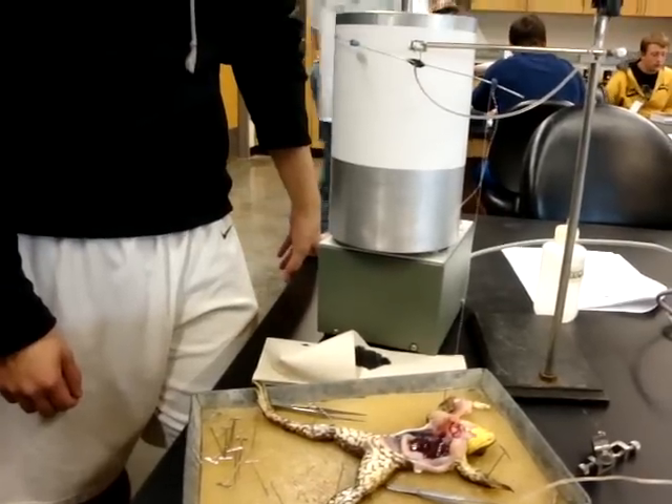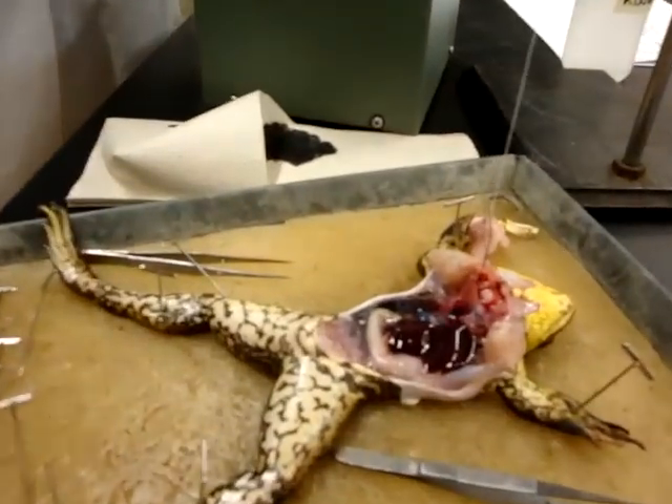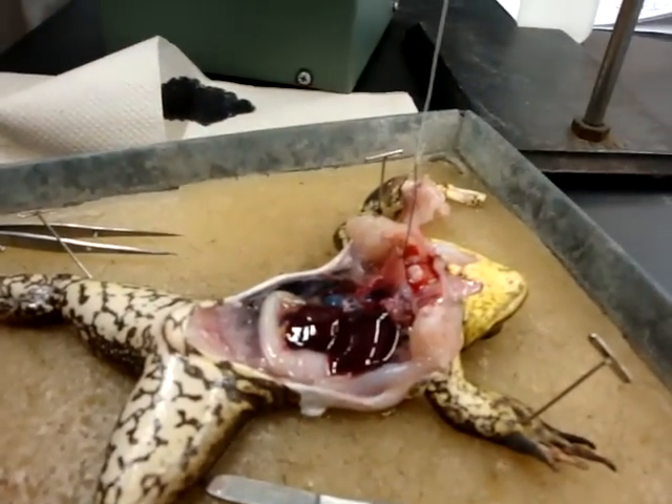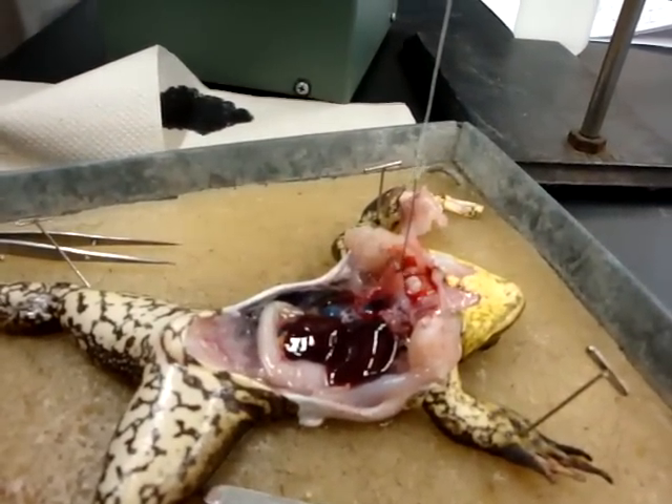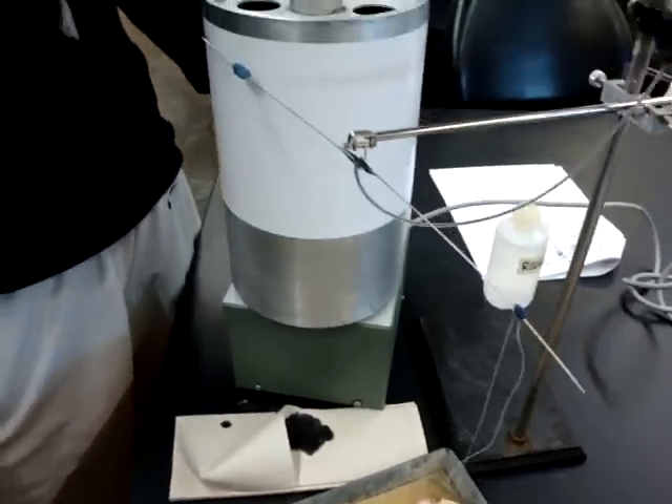You are, I think, the first group now to have your apparatus filled up. It is thrilling. It's like perfect. I love the dedication to science and recording posterity.